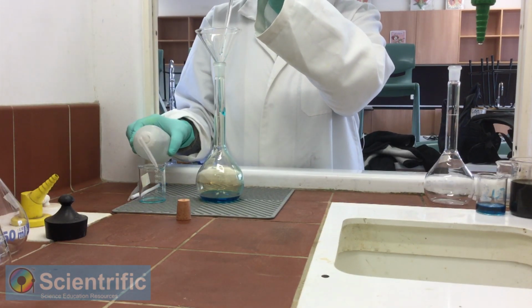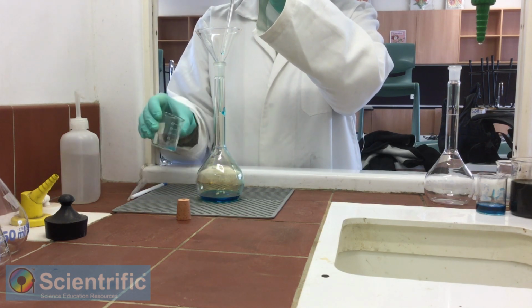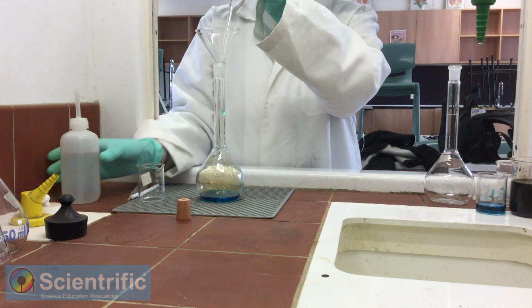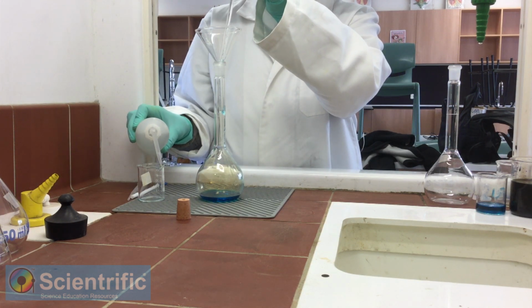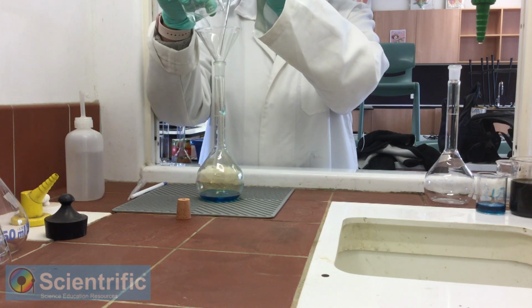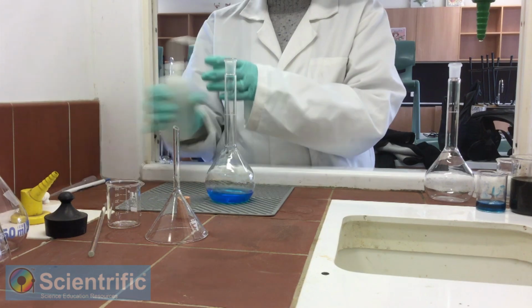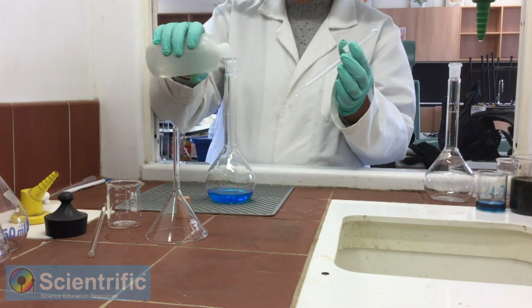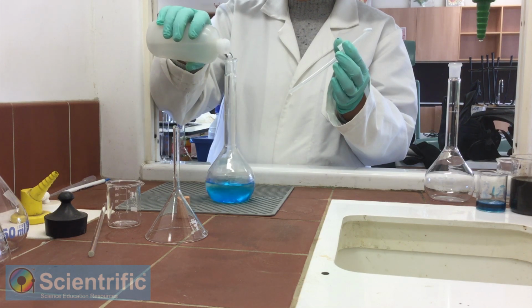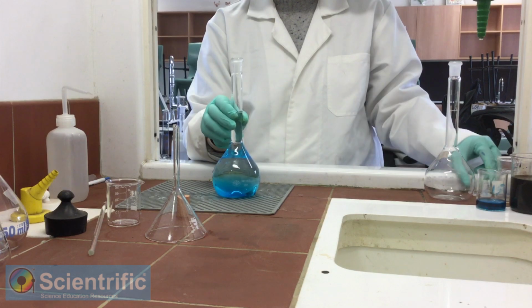Quantitative transfer means we continue to wash the beaker with little amounts of water. This is just so that I get every little speck out. We don't need to lose even a drop, because a drop, if you think of it in percentage level, is going to account for a huge loss. The next part is making it up to volume, making it up to the mark that is given over there. You can just allow it to go as quickly as you want. And yes, I've got it to the mark.